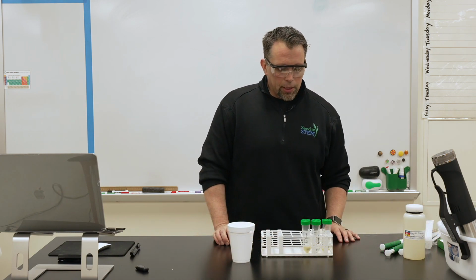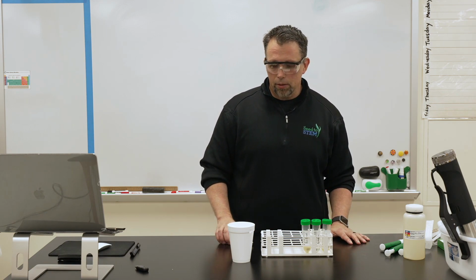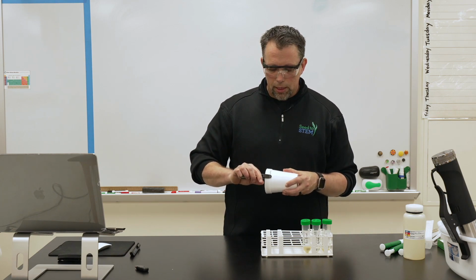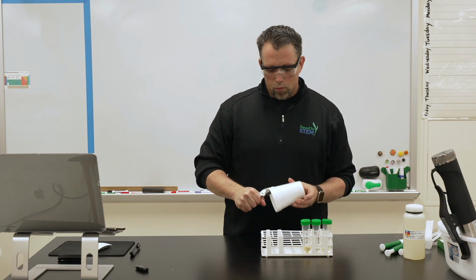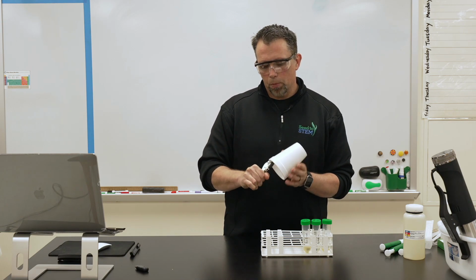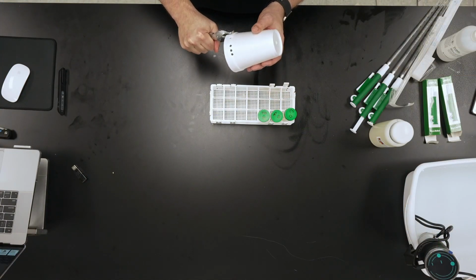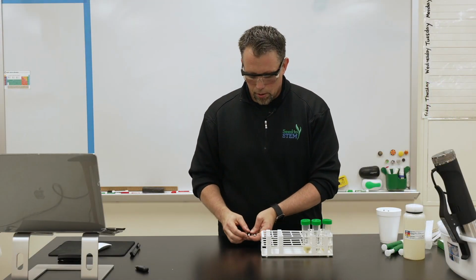All right, another interesting test is solubility. One of the problems that biodiesel ran into early is it's very capable of dissolving plastics and other things, and some engine components were made out of that. So for this test, you'll need a single hole punch and a styrofoam cup, and just punch some circles. In this case, I just need 3 with a hole punch.